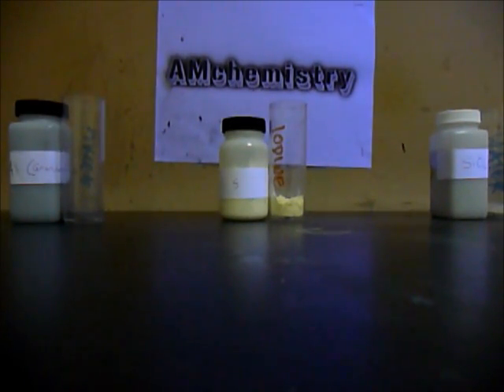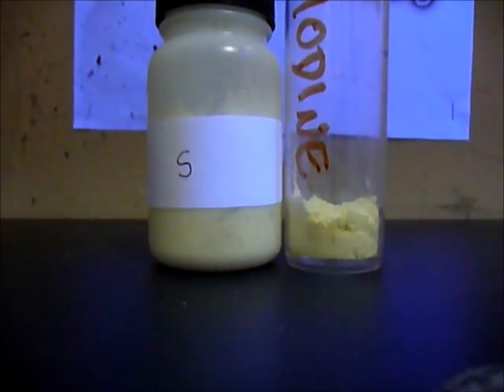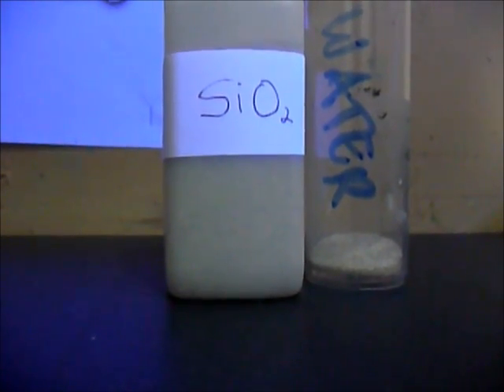Hi guys, in today's video I'll be showing you how to make elemental silicon. The chemicals you'll be needing are aluminum powder, sulfur, and silicon dioxide. You'll need 6.25 grams of aluminum, 7.50 grams of sulfur, and 5.60 grams of silicon dioxide, which is sand.